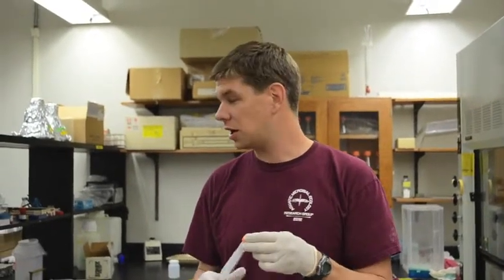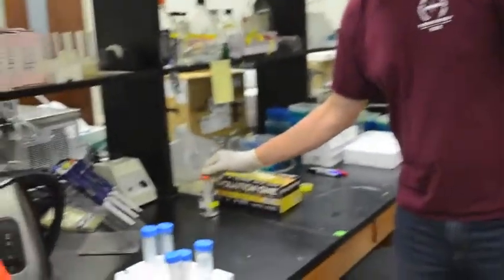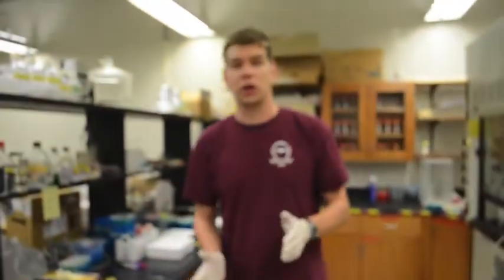The funny thing about DMSO is that, like I said, it looks like ice, but it actually has a freezing point instead of 32 degrees Fahrenheit. It's got a freezing point of about 55 Fahrenheit or so. So that means you actually have to get it fairly warm before it will melt. So the way that I'm doing this is that I am going to put it in this little beaker of warm water that I've set out, and hopefully by the time we're ready to use it, it will be thawed out. So now we're going to move on to the main task, which is measuring enzyme activities.